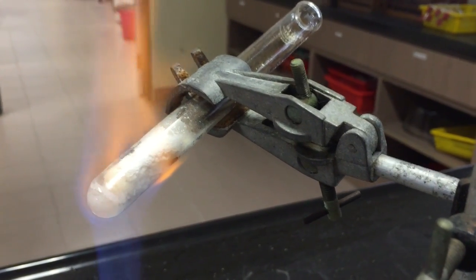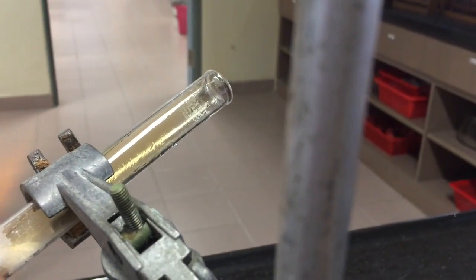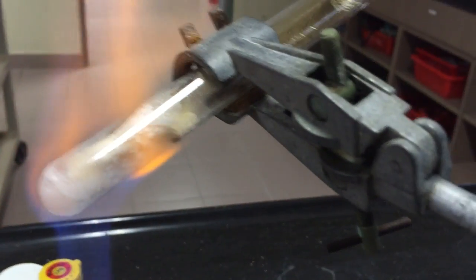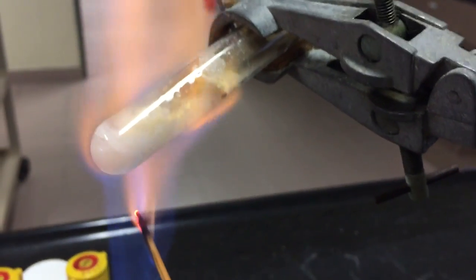After a short few moments of strong heating, you will start to notice a brown gas that forms. Do not be alarmed. This is the nitrogen dioxide gas that is being formed.